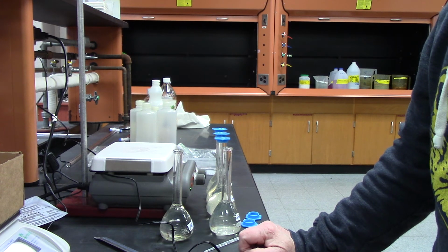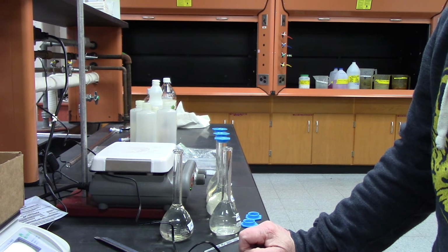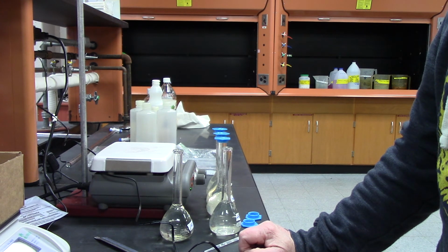All right, number 2 has an absorbance of 0.040.